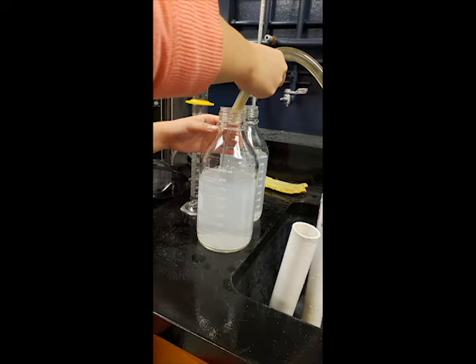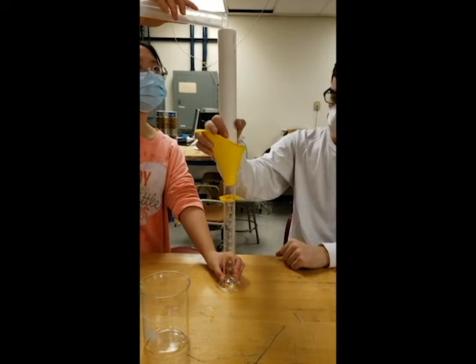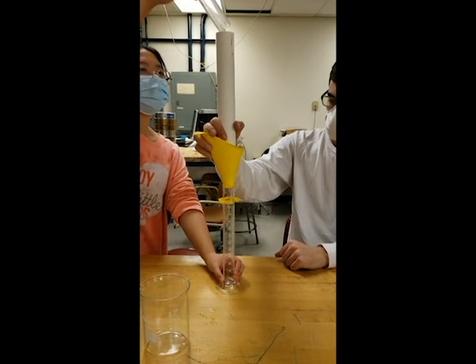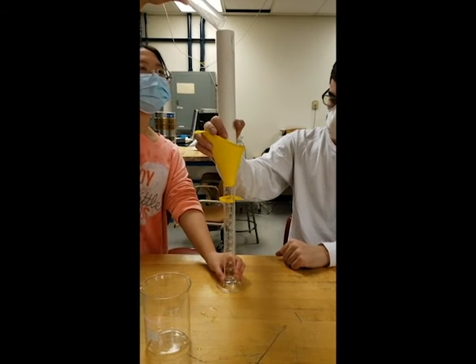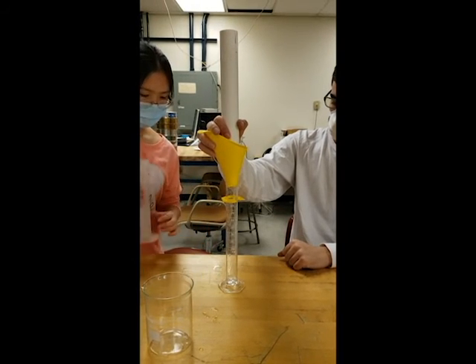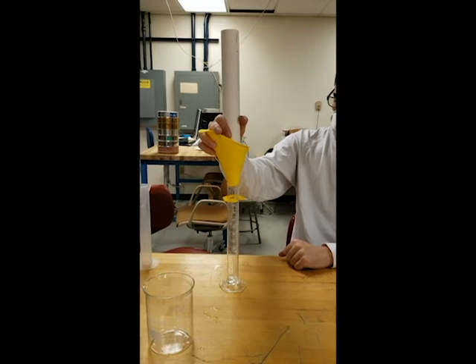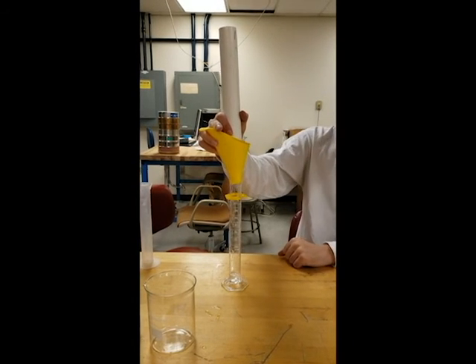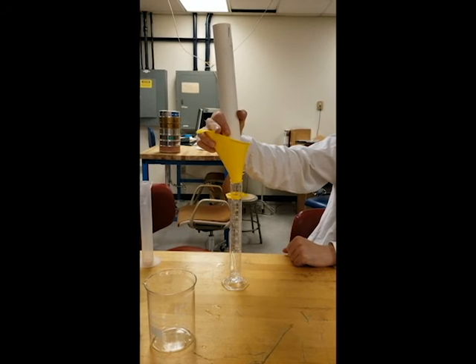We bought acetaminophen tablets and crushed them into a powder so it could dissolve in water. The initial concentration used was 0.5 grams per liter. We performed 5 trials for each bed height and ran samples of 20 milliliters of the solution through by pouring the solution through the top and collecting the filtrate. The volumetric flow was measured and averaged by timing how long it took the 20 milliliters to exit the column.